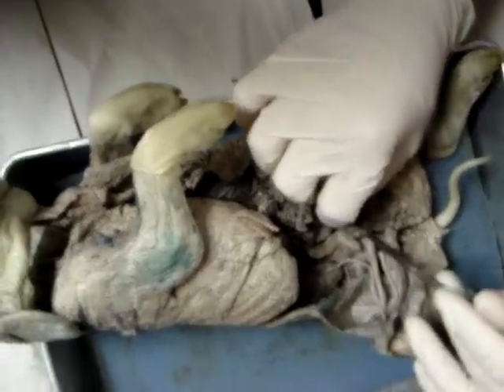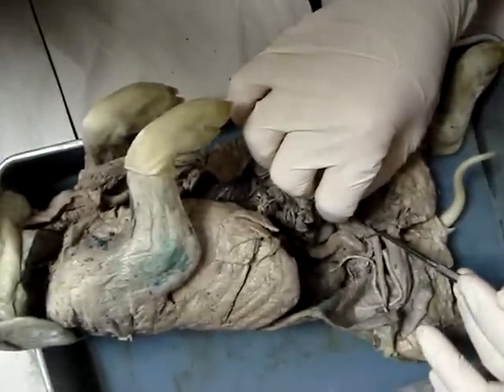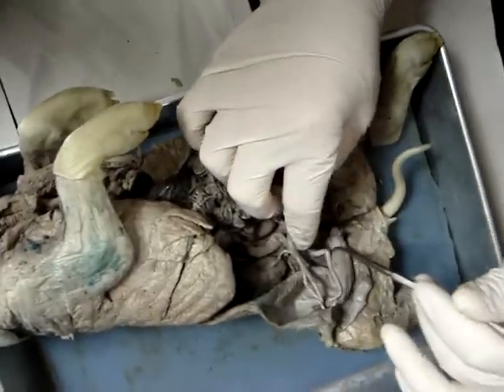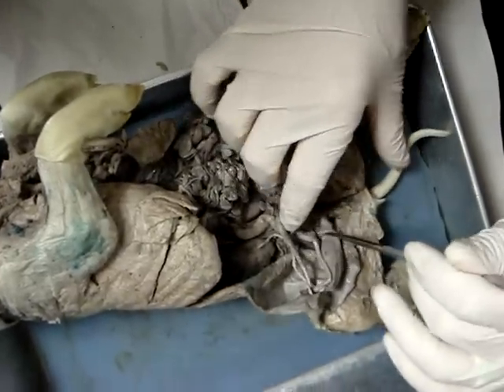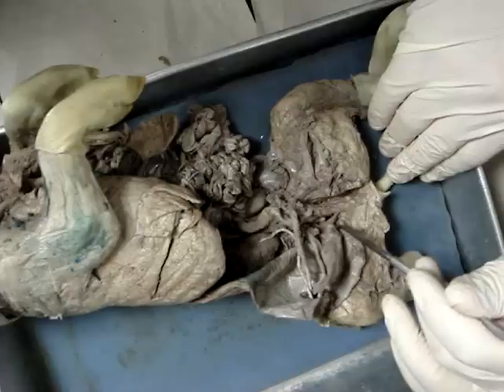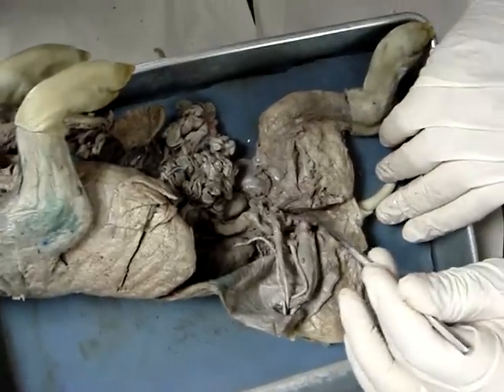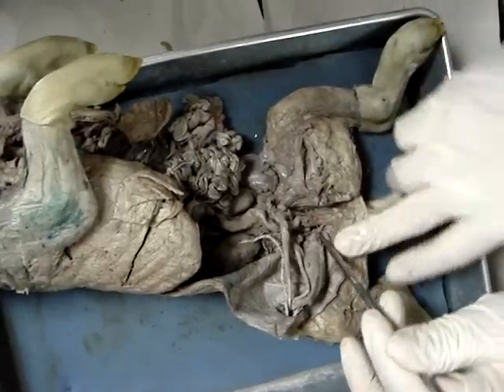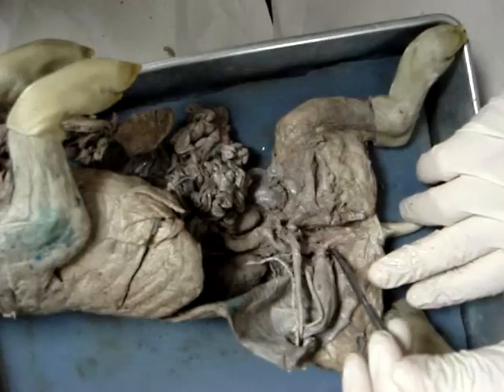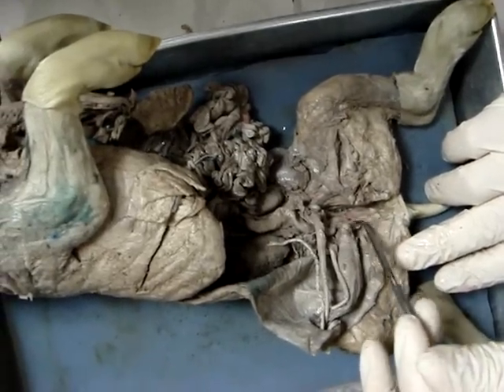If we follow the uterus down, it disappears down through here and it continues — and it continues down right through here. This tube right here is the vagina.